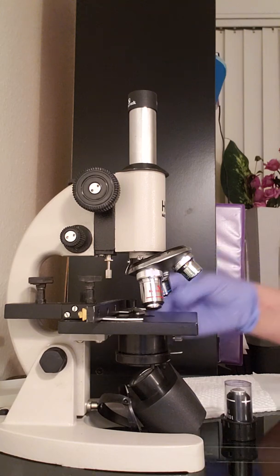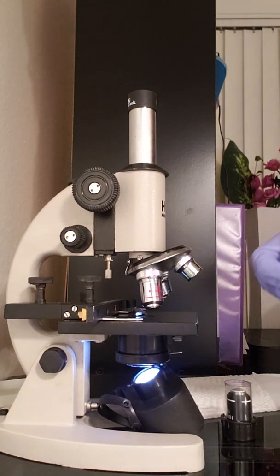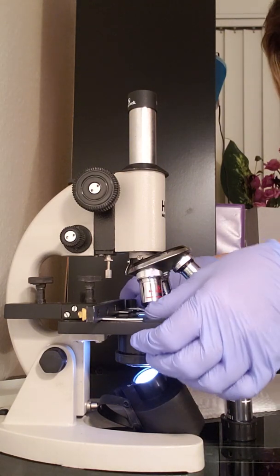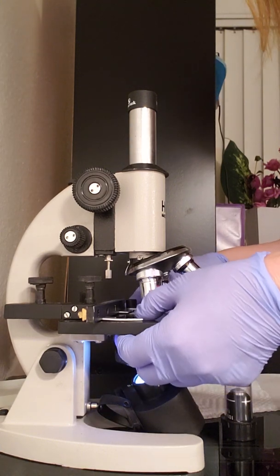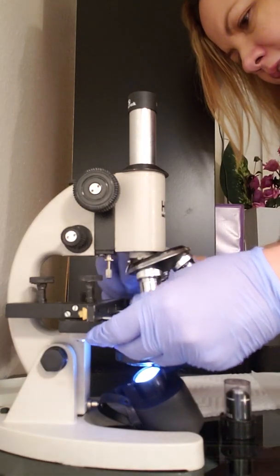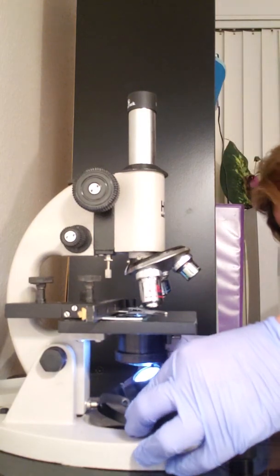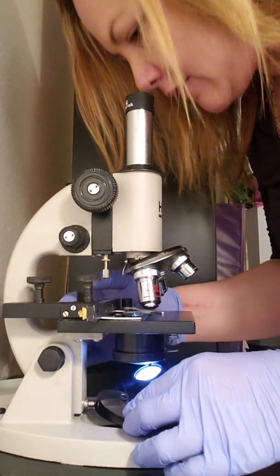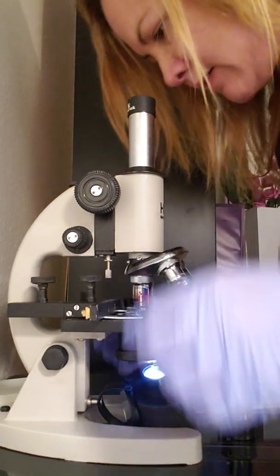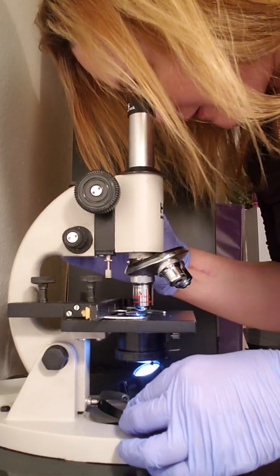And these, you can all put them on the microscope like so. So I'm going to just do a sample with the penicillium with candida. And I'm going to put it underneath. And this actually holds pretty nicely. And if you look through, it might help if I turn this on. And I'm going to try to put it on. Let's see. What do I do? Having a little bit of trouble with the, there we go.